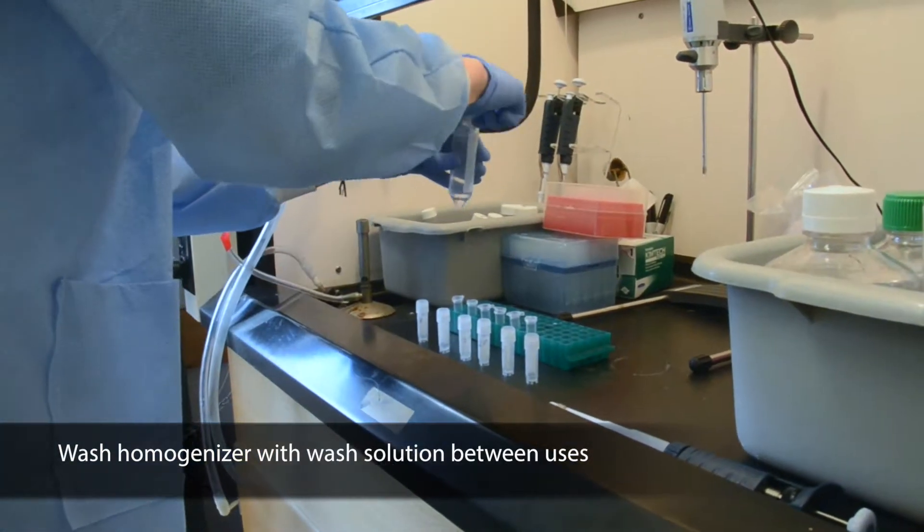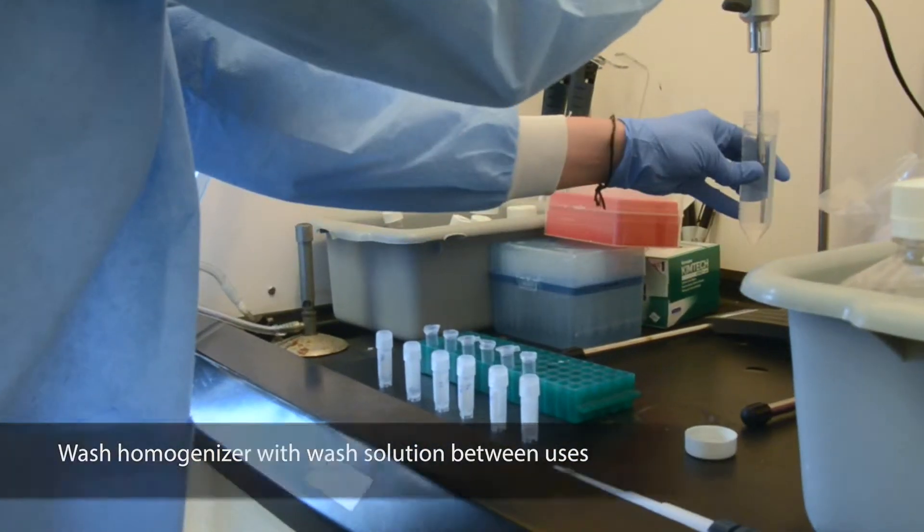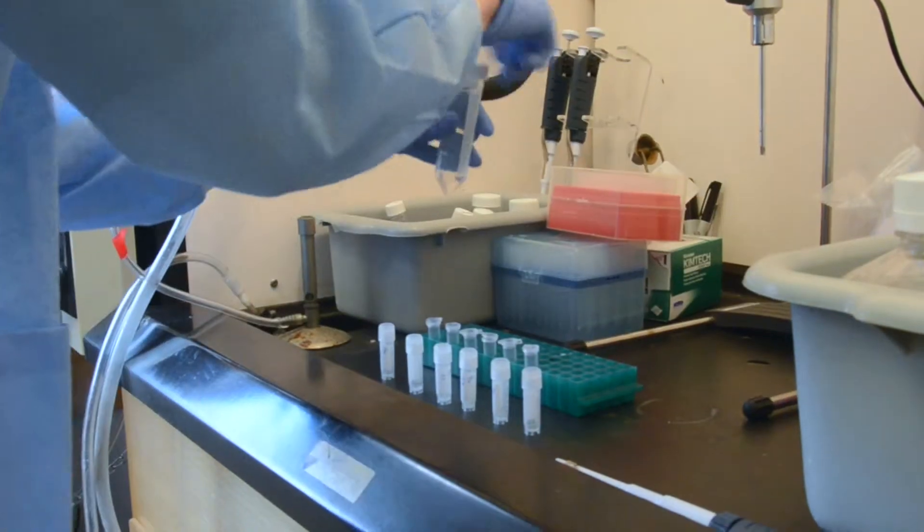The homogenizer should be washed with all three wash solutions before the initial sample that is being homogenized, and also between every additional sample.